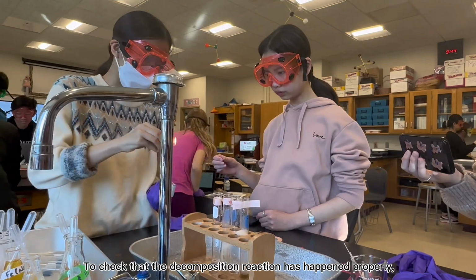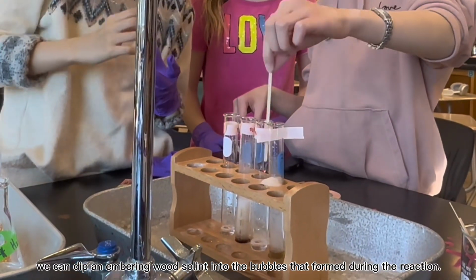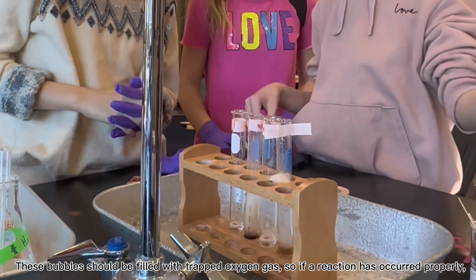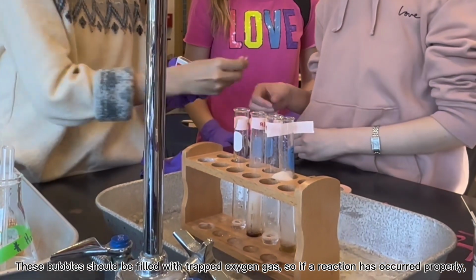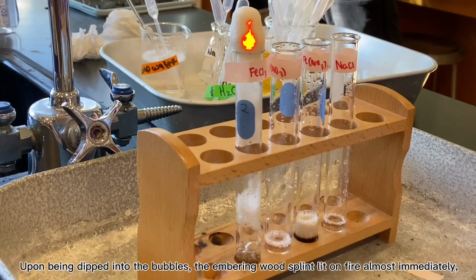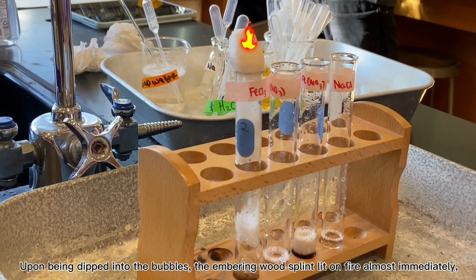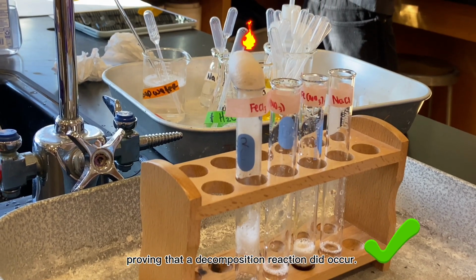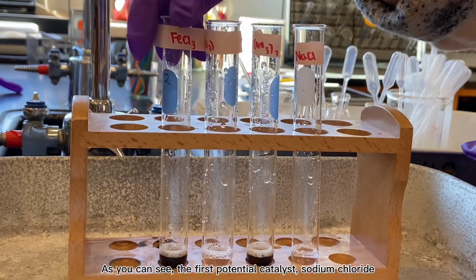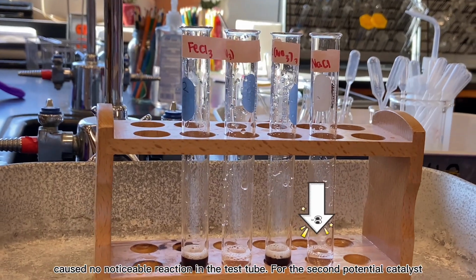To check that the decomposition reaction has happened properly, we can dip an embering wood splint into the bubbles that formed during the reactions. These bubbles should be filled with trapped oxygen gas, so if a reaction has occurred properly, the wood splint should light back on fire. Upon being dipped into the bubbles, the embering wood splint lit on fire almost immediately, proving that a decomposition reaction did occur. As you can see, the first potential catalyst, sodium chloride, caused no noticeable reaction in the test tube.